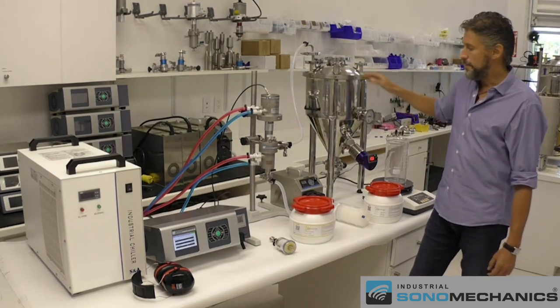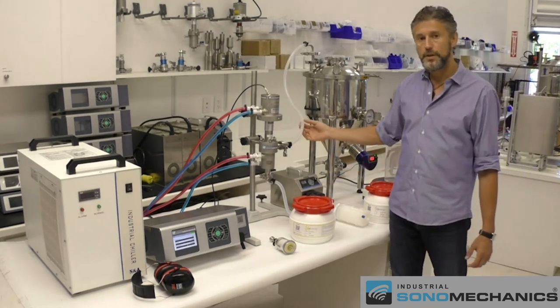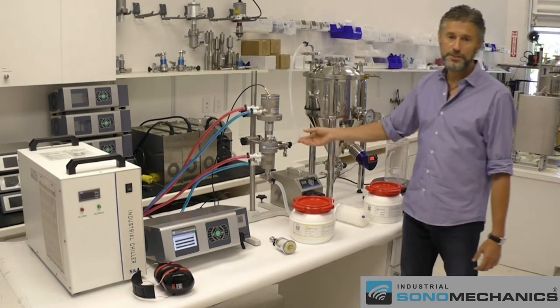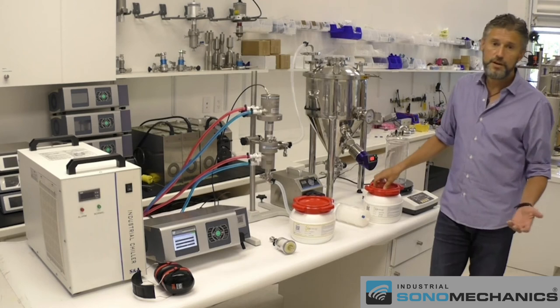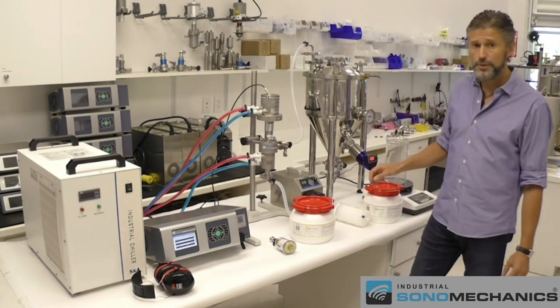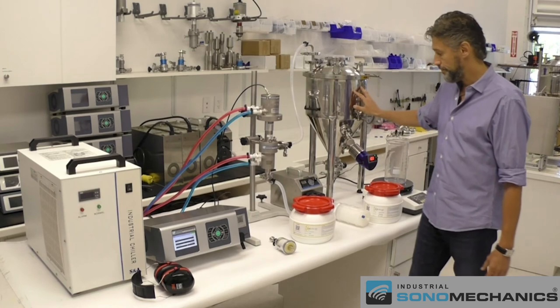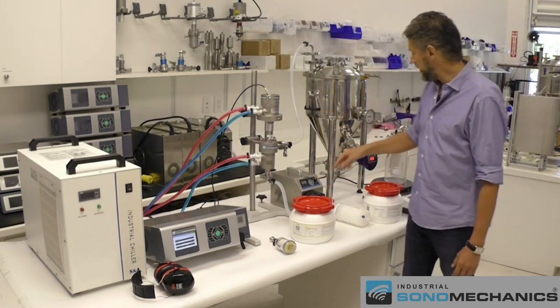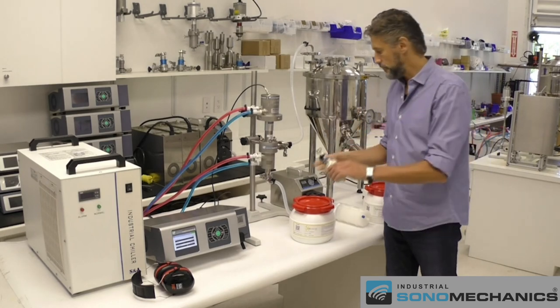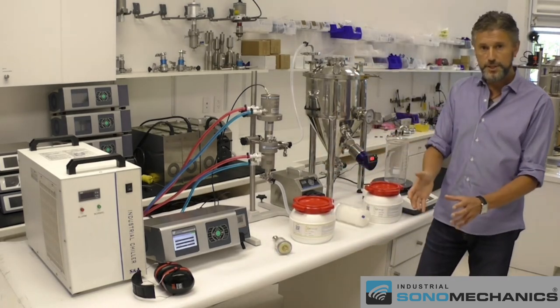The key difference with Nanostabilizer LSO is that it will not produce translucent nanoemulsions — the liquid will remain milky white. So you can't rely on translucency to know when the process is finished. Ideally, use droplet size analysis equipment such as a dynamic light scattering device. If you don't have access to that, go by time: 5 liters per hour. After that, stop the process, reverse the pump, collect everything into the tank. Disconnect the bottom fitting and connect the 1.2 micron filter, then pump the nanoemulsion in the forward direction into your finished product container.